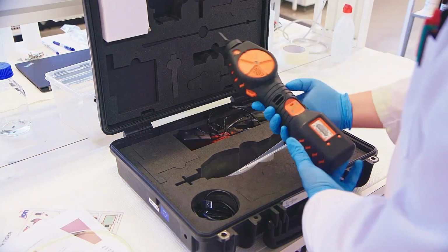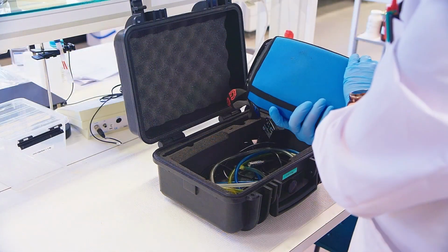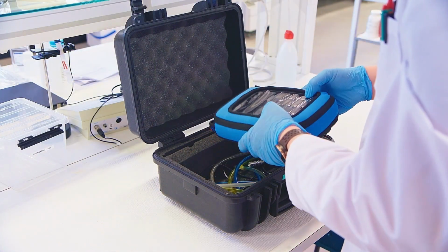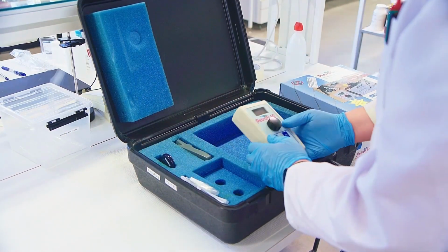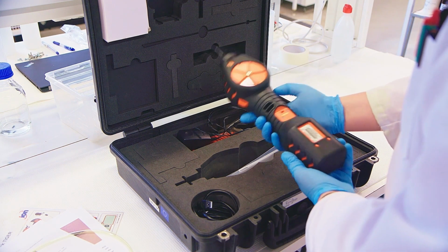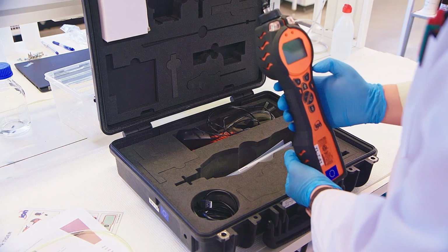The results of field measurements should also be verified by laboratory analyses, and the meters should be maintained and calibrated often enough. Next, this video will describe several field meters for studying the soil. The PID, or photo ionization detector, is a field meter for measuring the sum concentrations of volatile ionizable compounds.